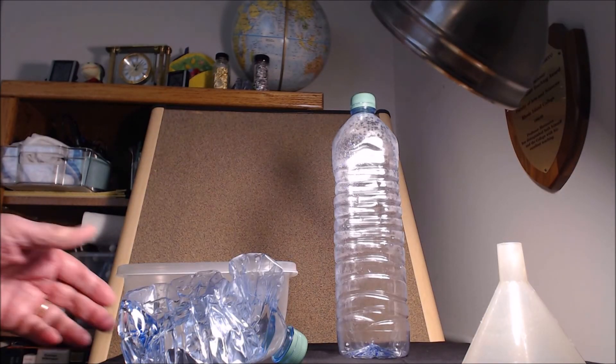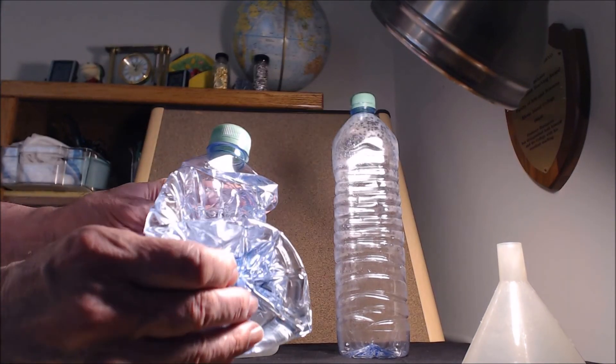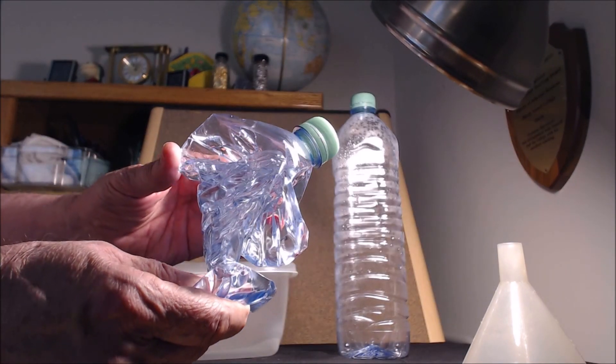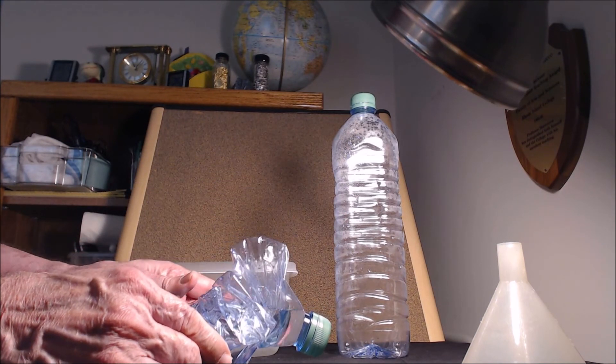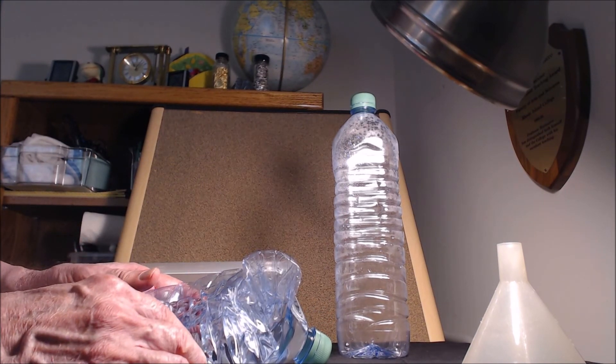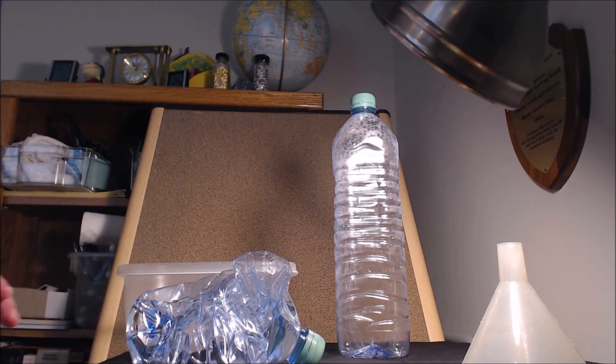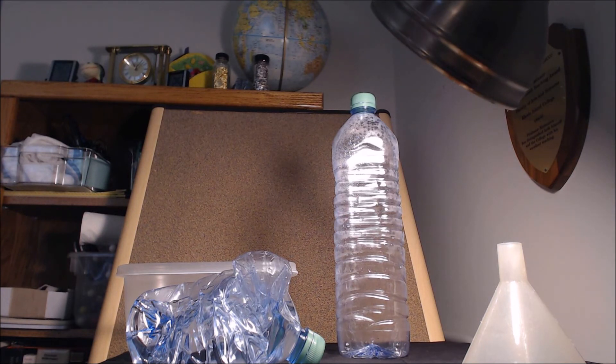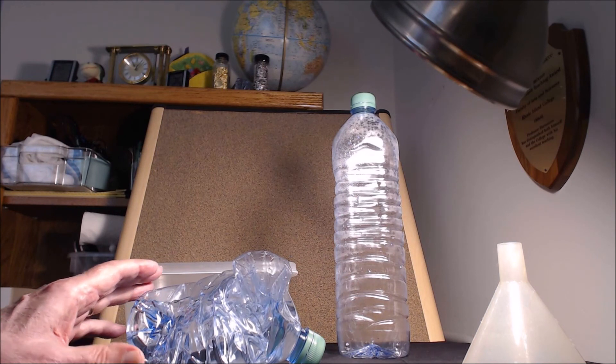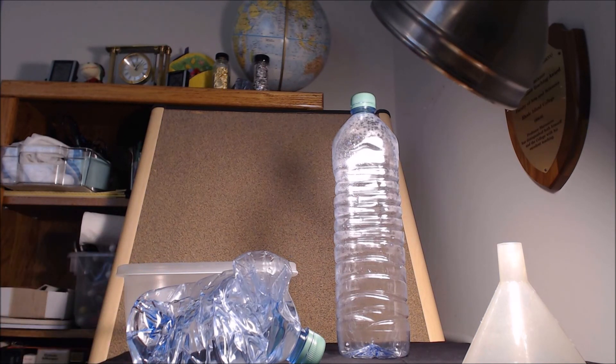Okay, well this is the final result. It's amazing how this just collapsed completely down and you could kind of leave it as a little reminder of carbon sequestration in your classroom. It's quite dramatic. Again be careful, this still has sodium hydroxide, it's not real concentrated but be very careful with sodium hydroxide. Thank you again, I hope you can use this as a demonstration of carbon sequestration.